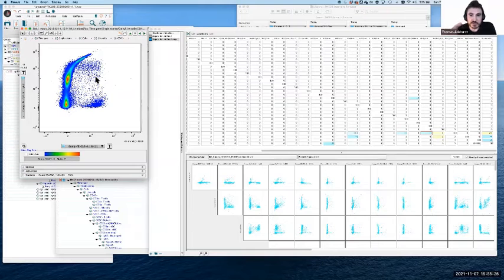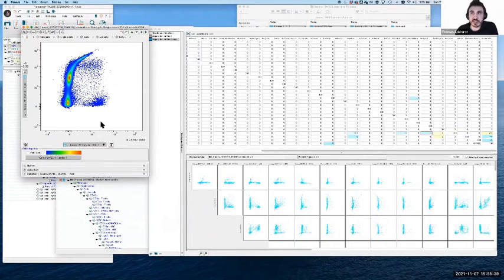It's a little bit counterintuitive to think about it this way, but after the data has been integrated, after the unmixing has been done, we can correct the individual integrated signals if we need to. So you may get a situation with your unmixed data where you see something like this. And as we talked about before, prevention is better than cure. There are a number of things that we can do to prevent these kinds of issues from happening. But the way the unmixing works is that, let's say it is not being fully extracted. At this point, the unmixing has been done, the signal integration has been done, and we can make small adjustments to the integrated channels simply by adjusting the matrix as we would before.